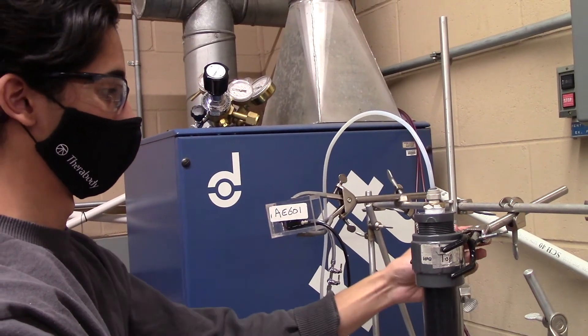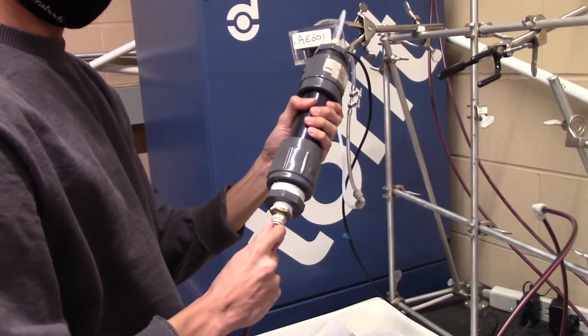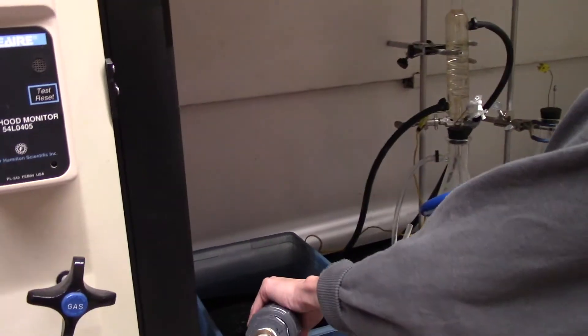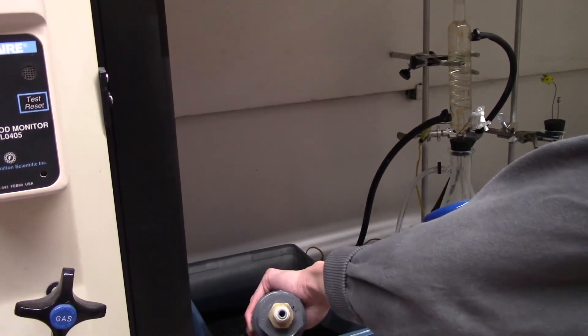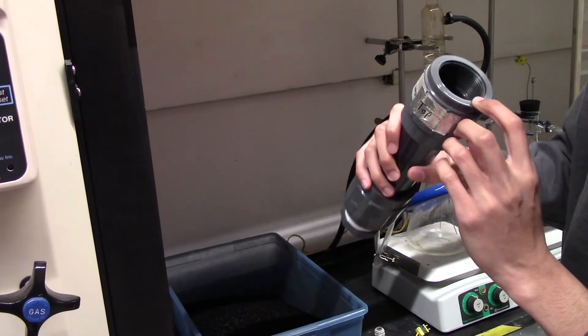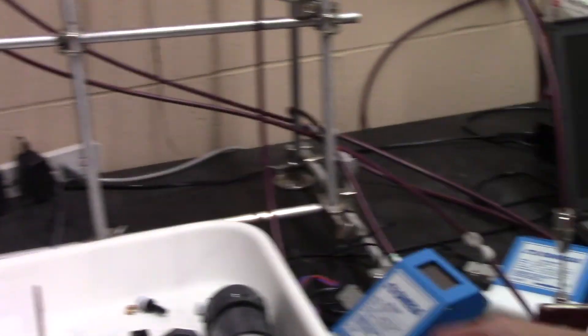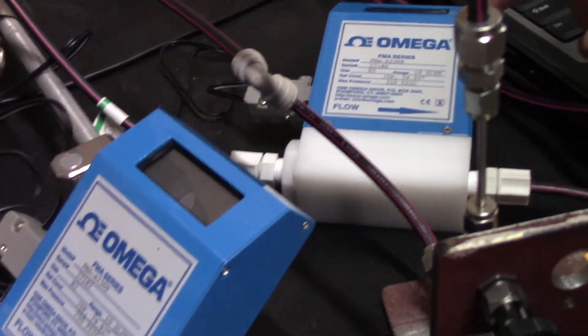We can now start the shutdown procedure beginning with unfastening the column and disconnecting the top and bottom tubing. Then empty out the carbon from the column into the used carbon tray, again making sure that the inside mesh is visible. Finally, power off the surge protector switch and make sure all electronic devices are turned off.